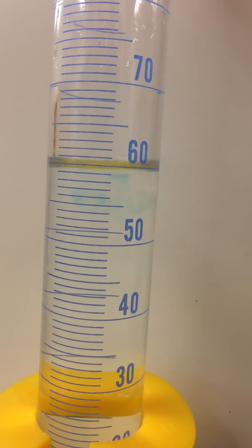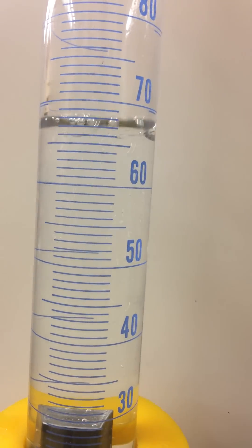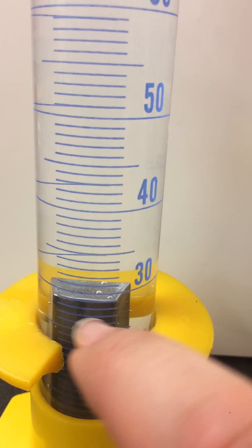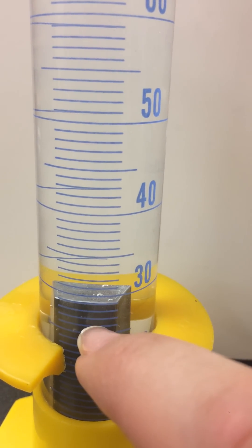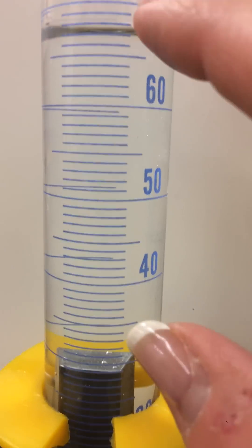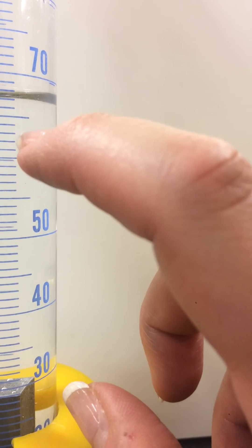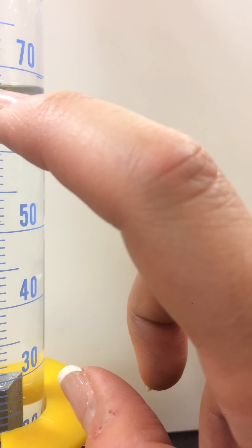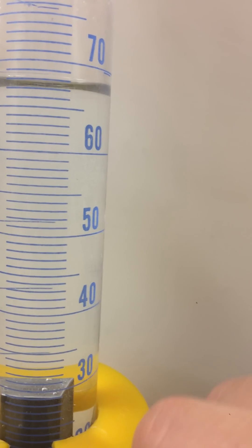Now you place the object in. You can see the object fell into the graduated cylinder. The object has a volume, which is why it pushed all the water up — now the volume went up to 65, 66, 67 milliliters.